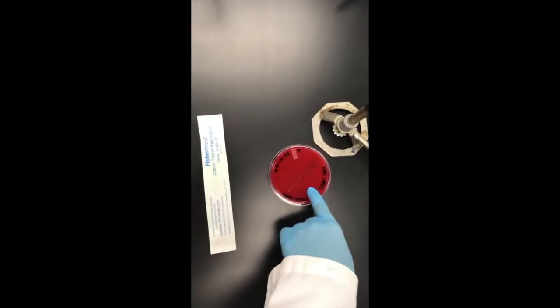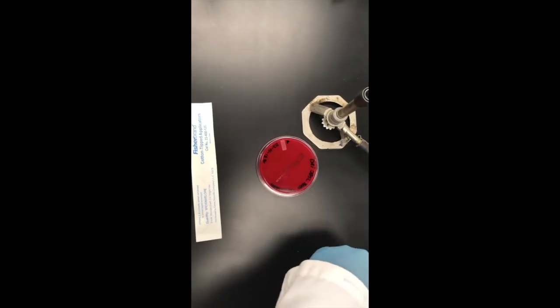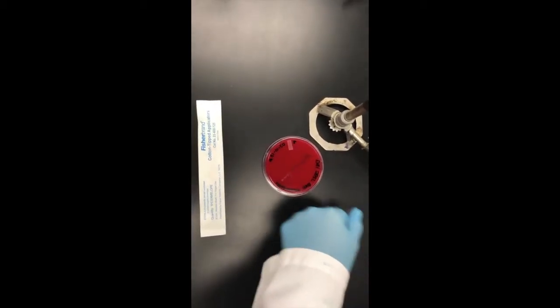The blood agar plates are going to be a little bit softer than the regular LB plates, so just be careful.